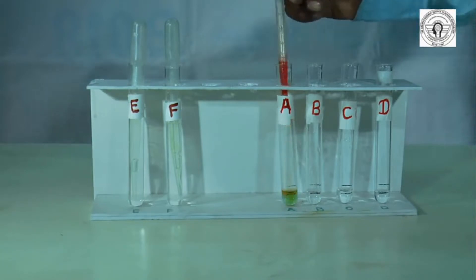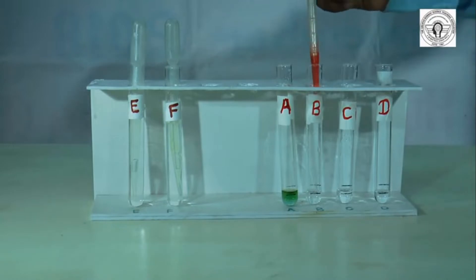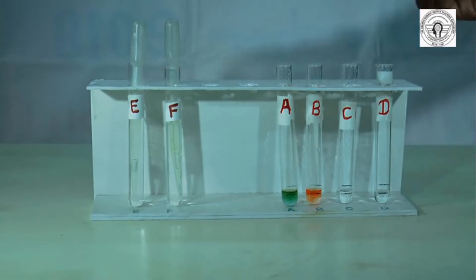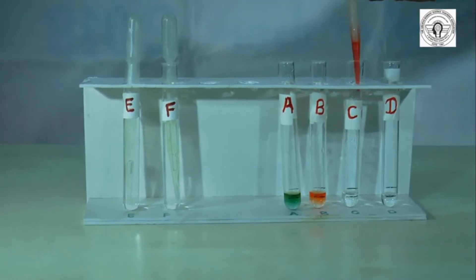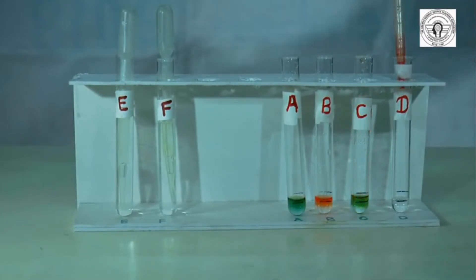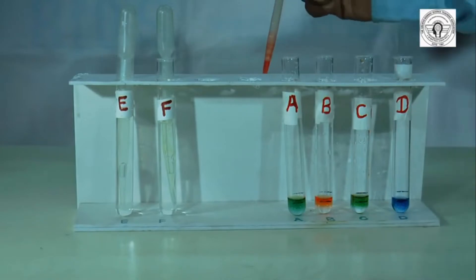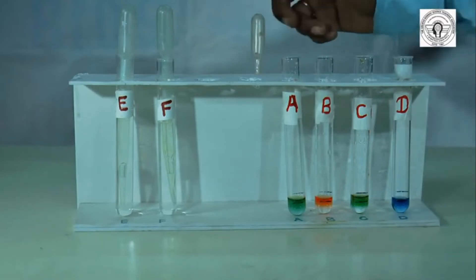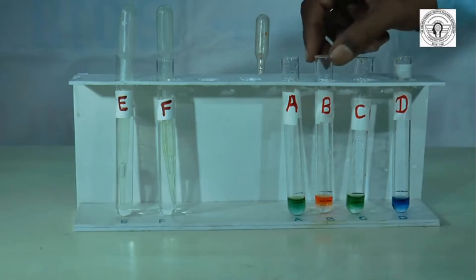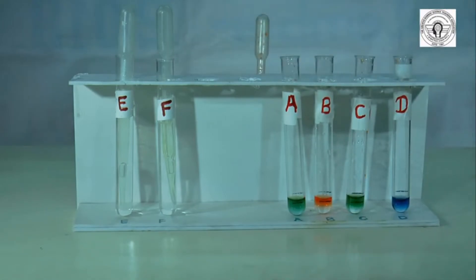Add 1, 2 drops into test tube A; similarly 2 drops into test tube B, 2 drops into test tube C, and 2 drops into test tube D. Observe the color in each test tube and write it in your observation table.